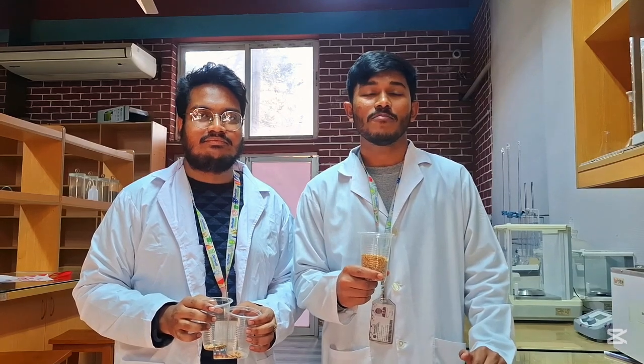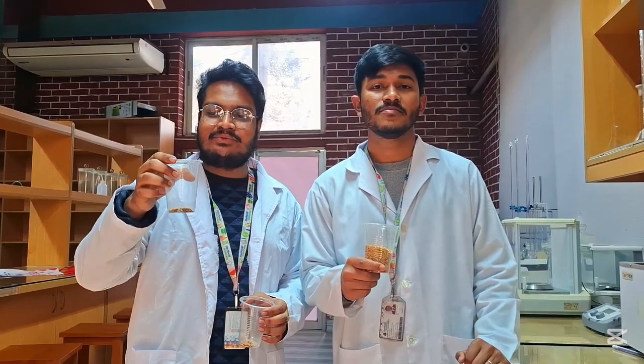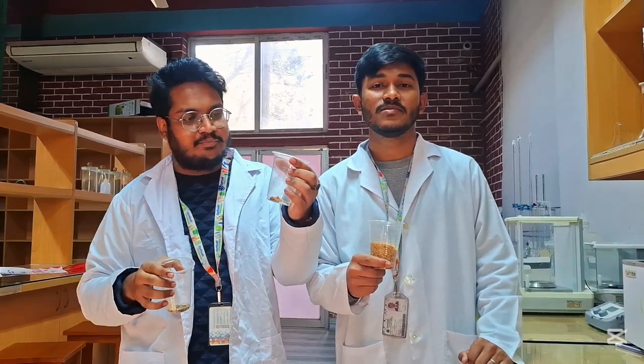The final result of my experiment: the pure seed is 82%, other crop seed 11%, and inert matter 7%.